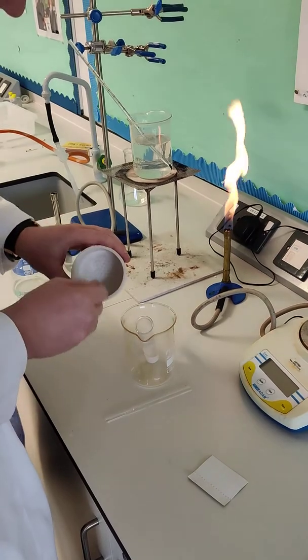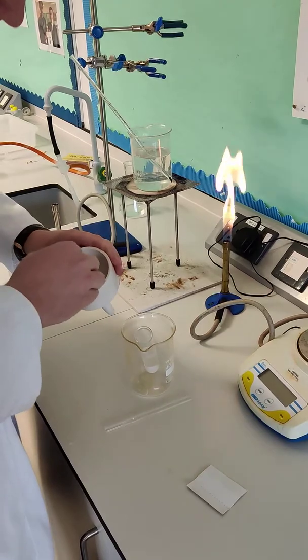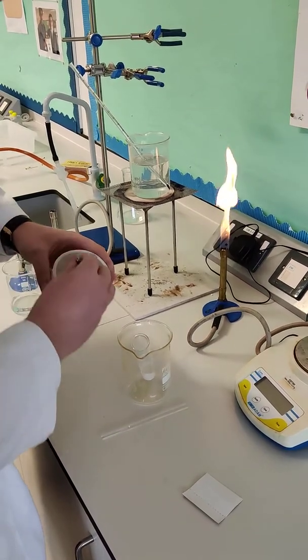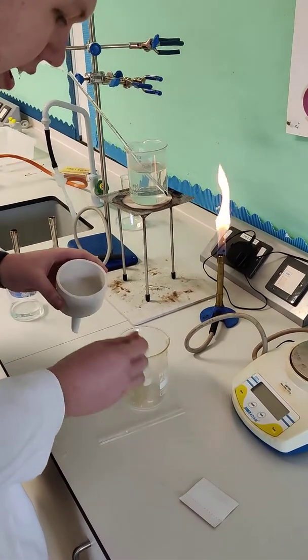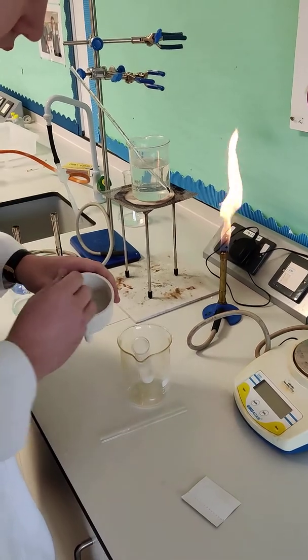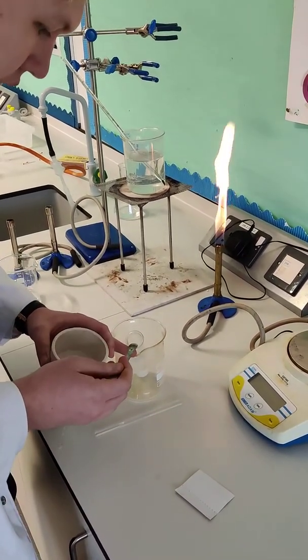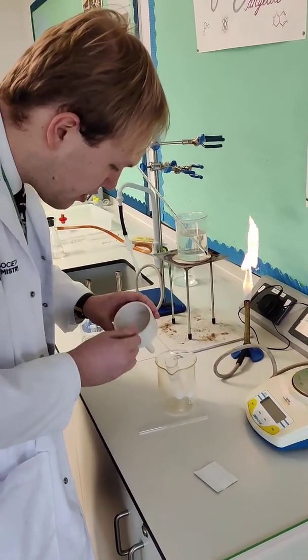Why are we being very careful to get as much of the product as possible? It's because one of the common mistakes chemists make is leaving a lot of product behind in whatever filtration apparatus they're using. These steps accumulate over time and result in a very low yield. So you want to be precise — there's no point rushing it. Making sure to get every last drop, even the stuff on the spatula.